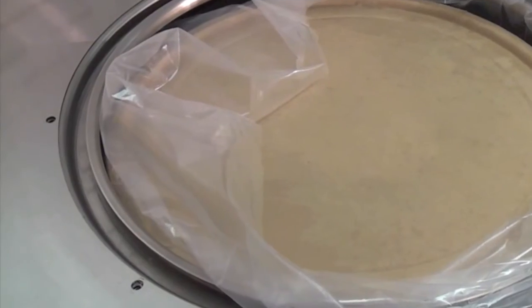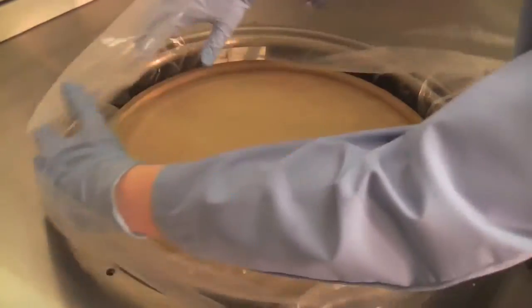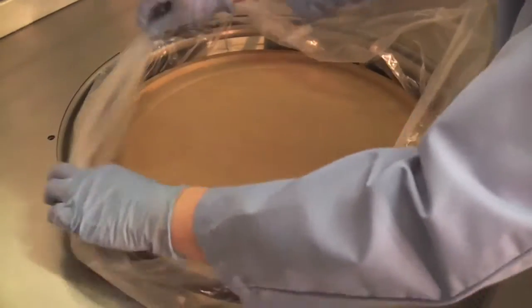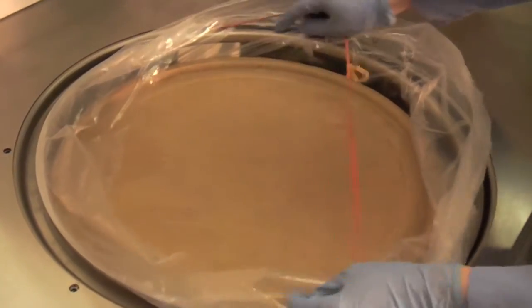Locate the lower retaining ring on the work surface. Pull the safety sleeve up through the work surface and, with the retaining band, secure the sleeve to the lower retaining ring. Place the excess sleeve in the space around the ring.